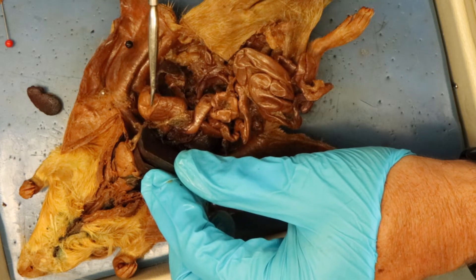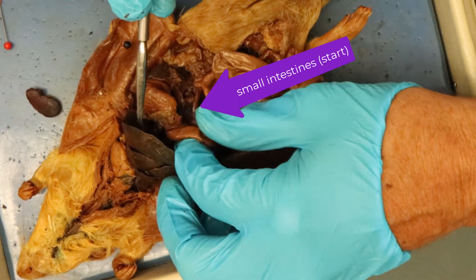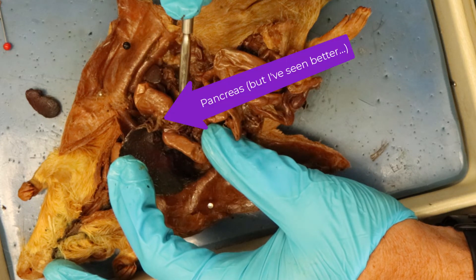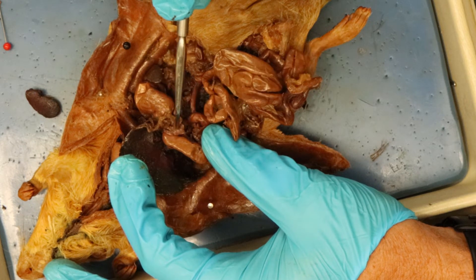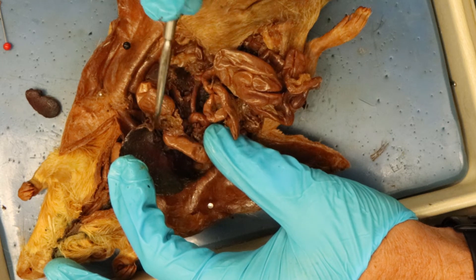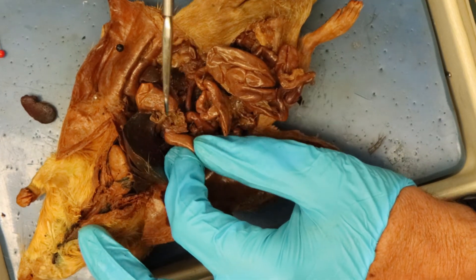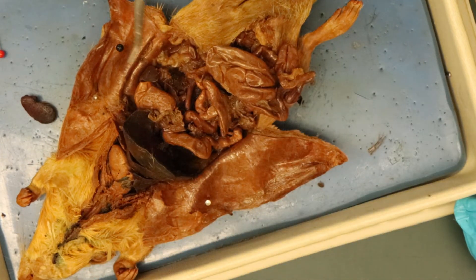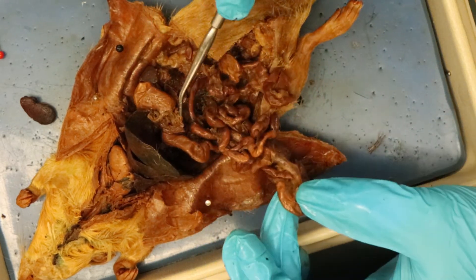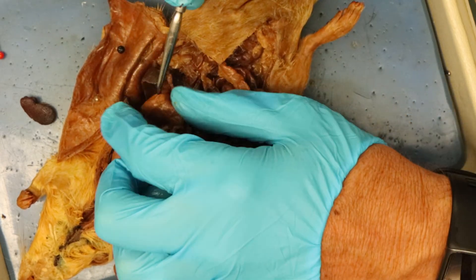We have the liver down here. If I move the liver aside I can see the stomach, and the stomach connects to the small intestines — not terribly clear in this particular dissection. This in part is the pancreas right here; some of it broke off. The pancreas sits at the junction of the stomach and small intestines. Pancreas is best seen in the bird — the rat sometimes gives you a good one, but this time it doesn't look so great. Small intestines are down here.